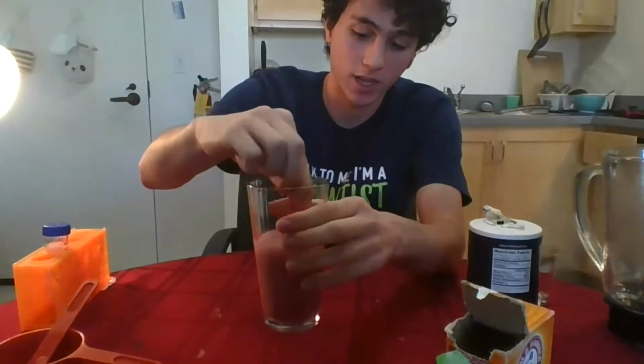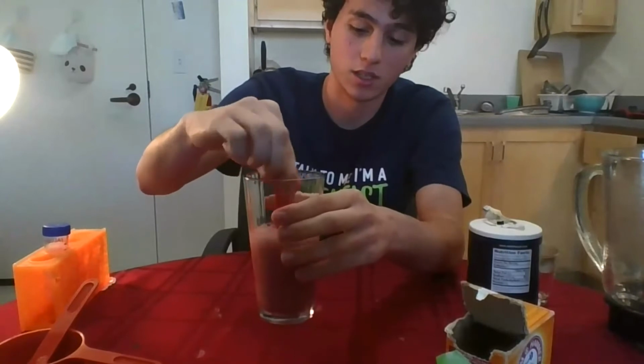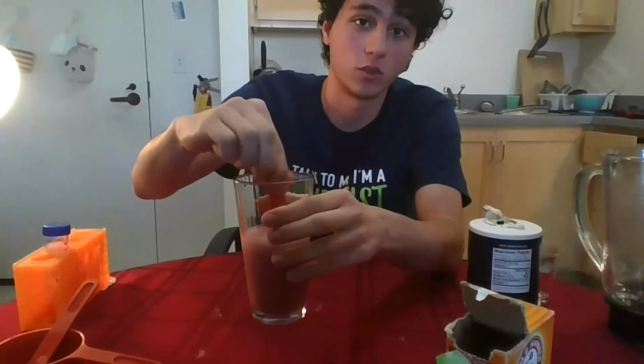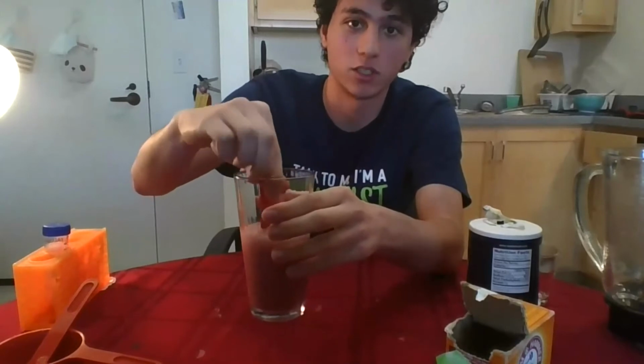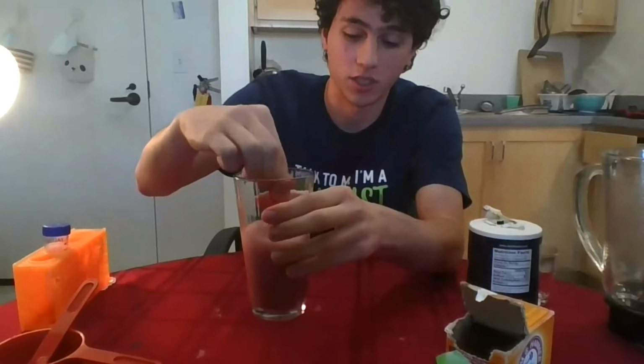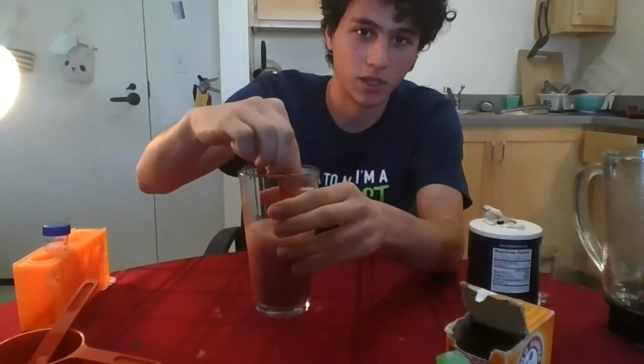And the reason why that's happening is because the baking soda is doing exactly what Gabriella was talking about earlier. It's going after those little workers, the little proteins that are reading the DNA library in each of the cells. And since we don't want those there because they're going to make it harder for us to extract the DNA, we add the baking soda, and the baking soda neutralizes them and stops their function.